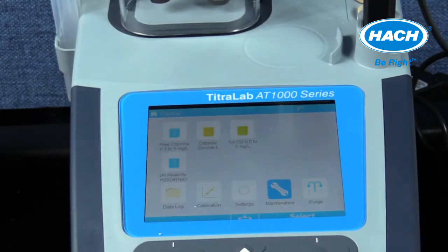Syringe setting in the Titrator software uses a 10 ml syringe volume as the default. The syringe size can be changed in the software from the home menu and performing the following steps.